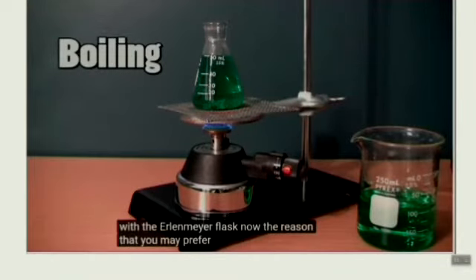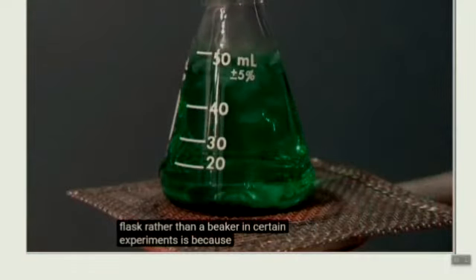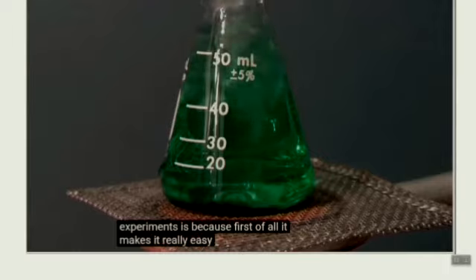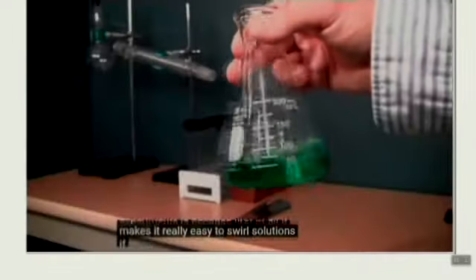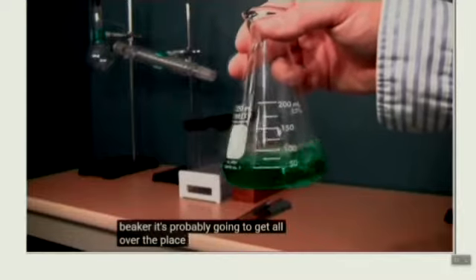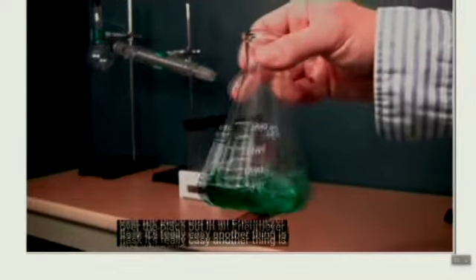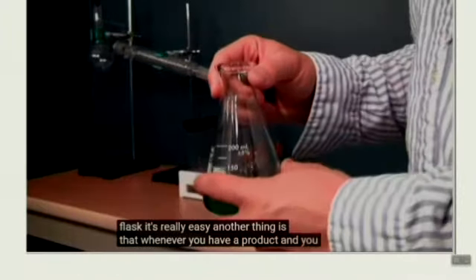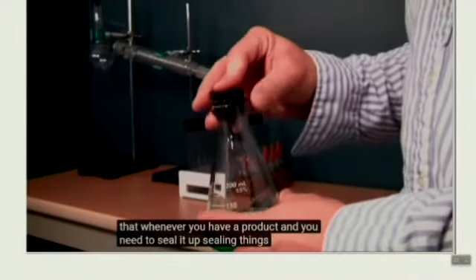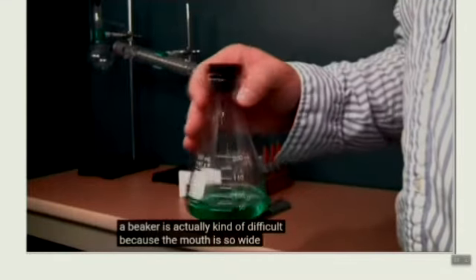The reason that you may prefer to use an Erlenmeyer flask rather than a beaker in certain experiments is, first of all, it makes it really easy to swirl solutions. If you try to swirl a solution in a beaker, it's probably going to get all over the place, but in an Erlenmeyer flask, it's really easy. Another thing is that whenever you have a product and you need to seal it up, sealing things up in a beaker is kind of difficult because the mouth is so wide.